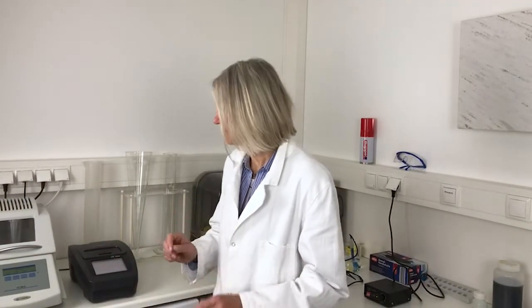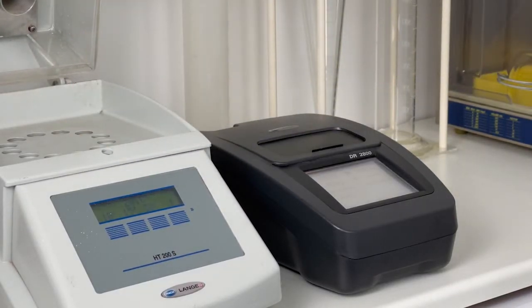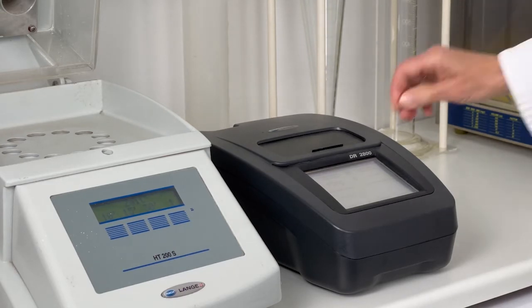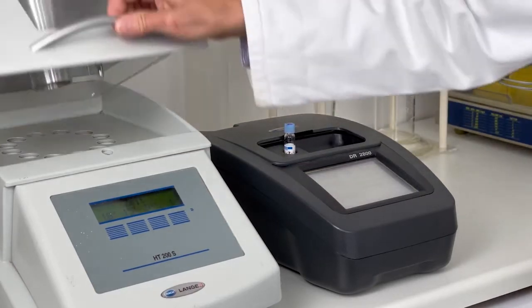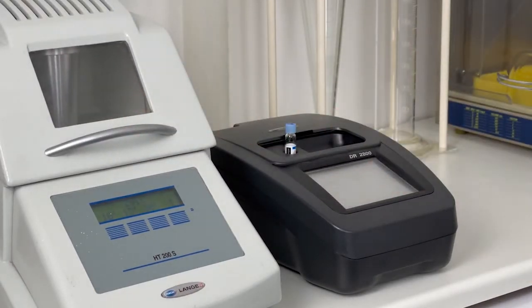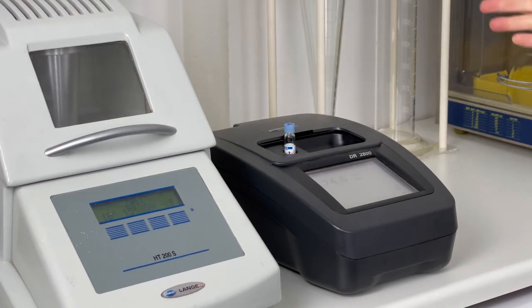I think the COD is ready. We take it to the photometer and measure the concentration of the COD in the probe. It's about 74.6 milligrams per liter — that's fairly low. And that gives us a hint for the cleaning procedure, and I think it's well performed.